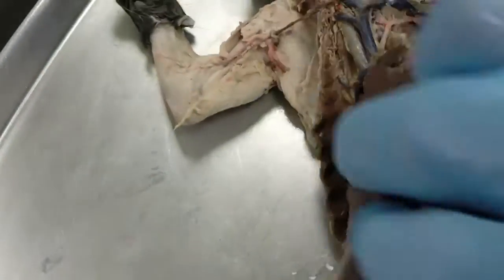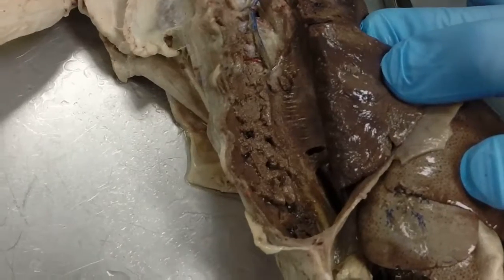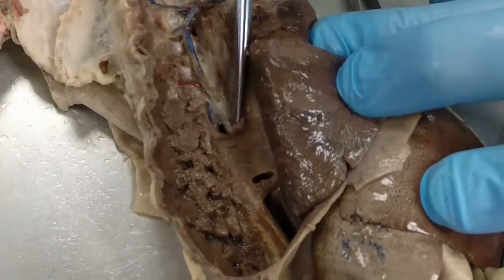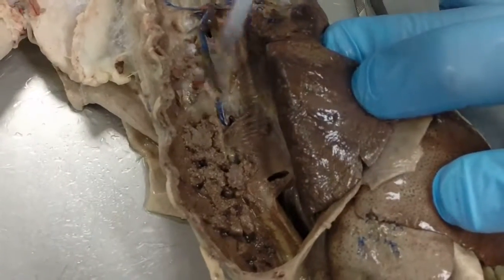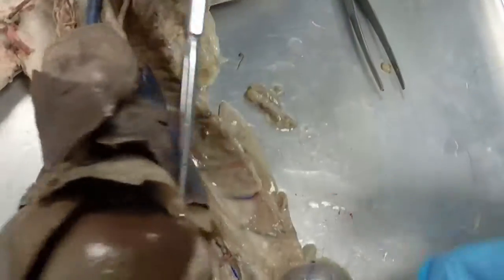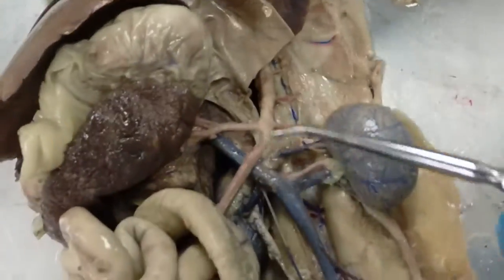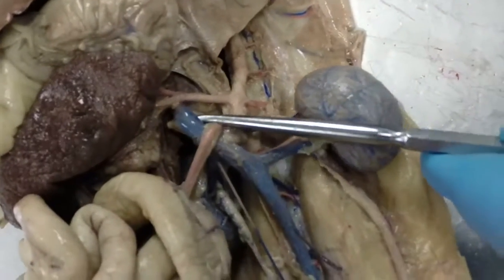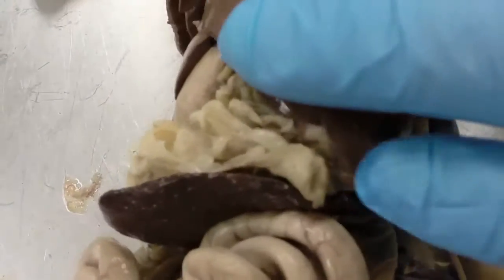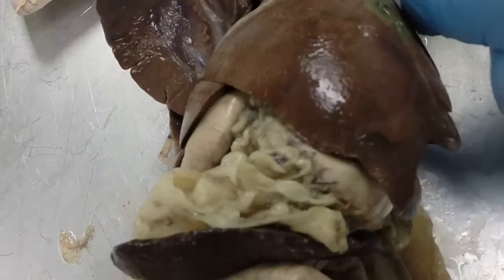If you go over on the right side, going along kind of near the ribs over here, we have this vein. This is called the azygous vein right there, and it's not really dissected out, but you can see it clear enough right there. There's your azygous vein. Okay, next if we move into the abdominal cavity, we have what we call the postcava. And so this is called the postcava anywhere posterior to the heart. So there's your postcava in the thoracic cavity.